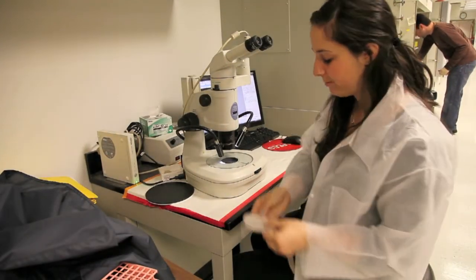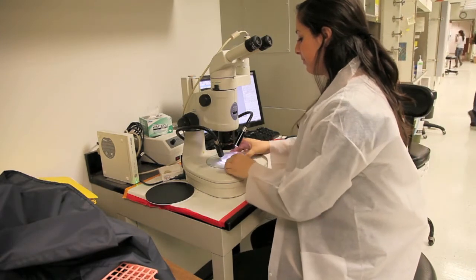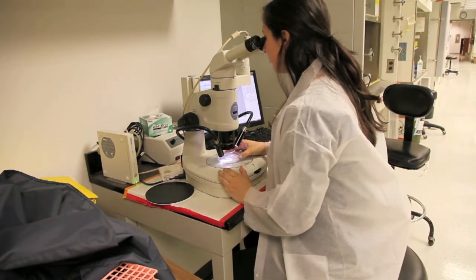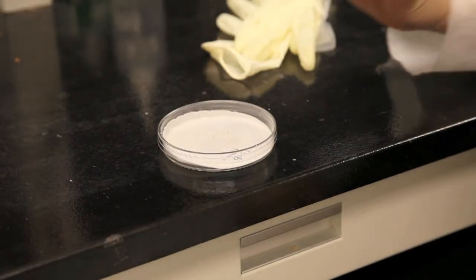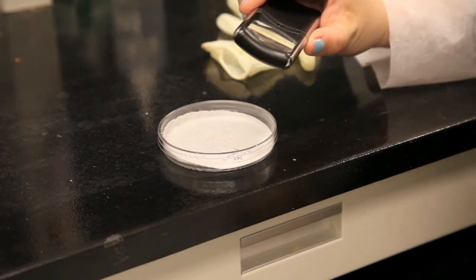Each day following, keep track of your seeds. You can do this by looking at the plates under the microscope, but if such facilities are not available, a magnifying glass will work just as well.